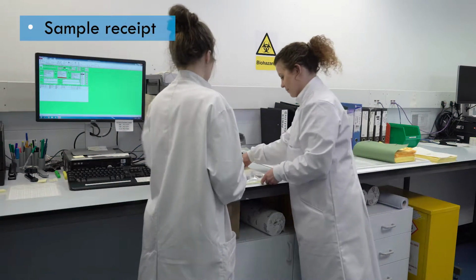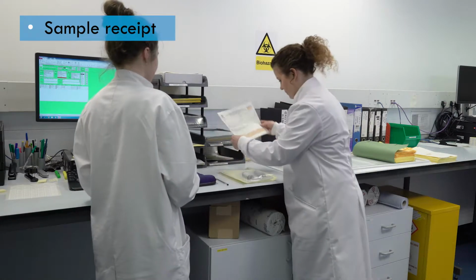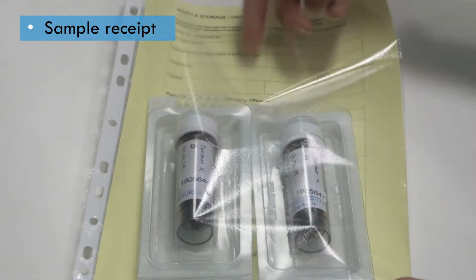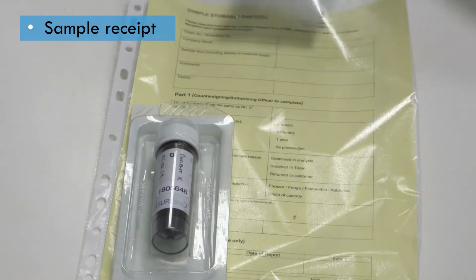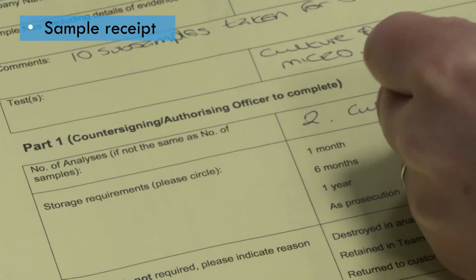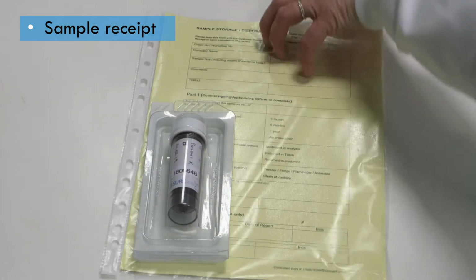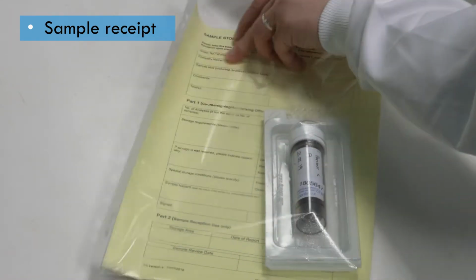Before starting any work, the information received with the sample should be checked to ensure it is present and correct, and has been logged into the system. The sample should be clearly labelled to ensure it cannot be confused with other samples. Where multiple analyses are required on the same sample, the procedures must be carried out in the right order, and if any subsamples need to be taken from the primary sample, this should be agreed before processing starts.